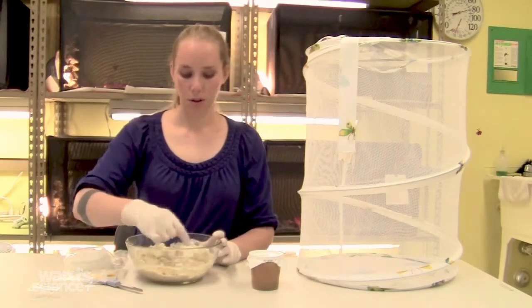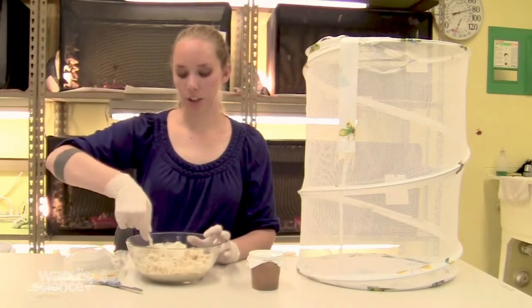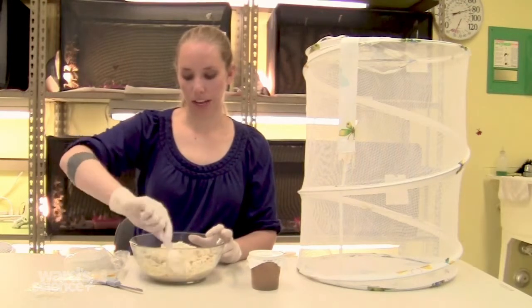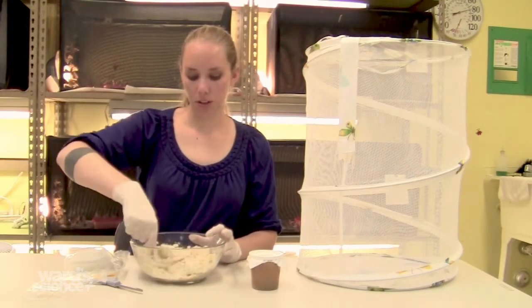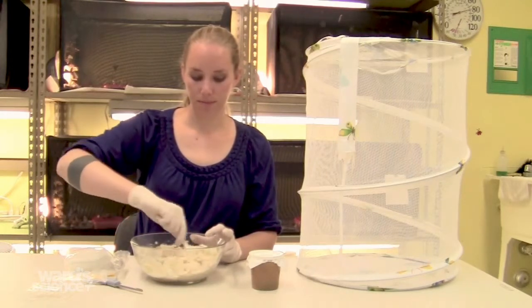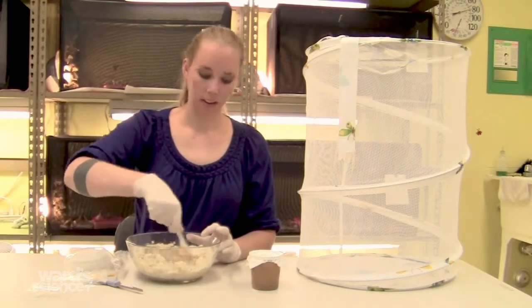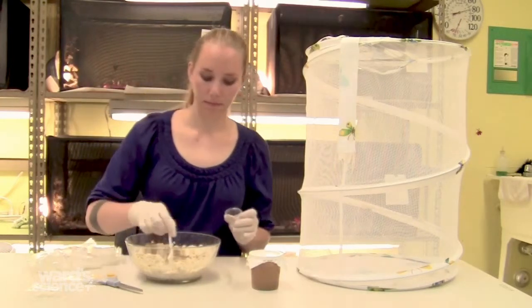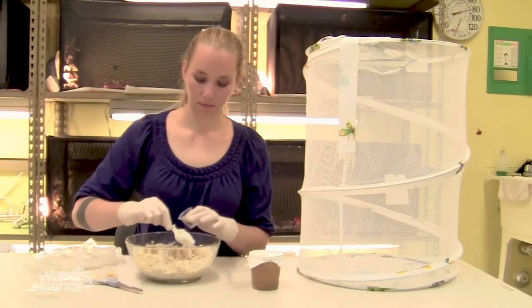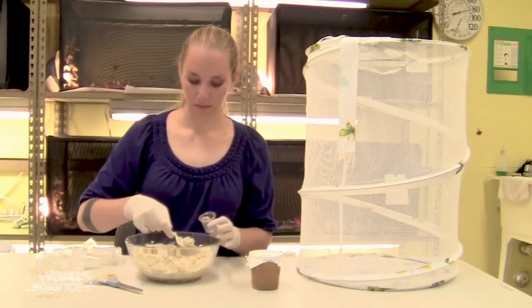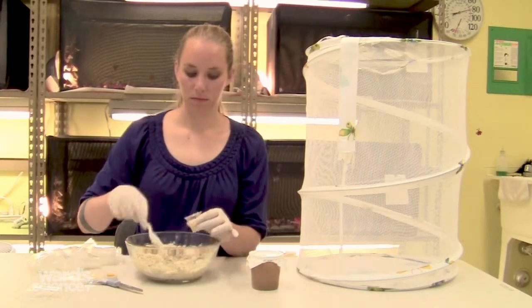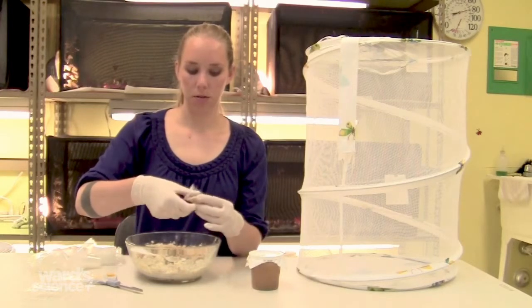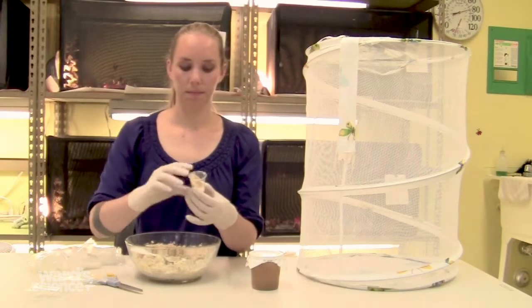When you're done mixing the food, you want to push a teaspoon of the food into each of the individual cups. Push it in at an angle so that the waste all falls to the bottom and doesn't lay on the food. You should wear gloves while you do this to decrease the chance of contamination. That's looking pretty good. So you push it in at an angle, like this.